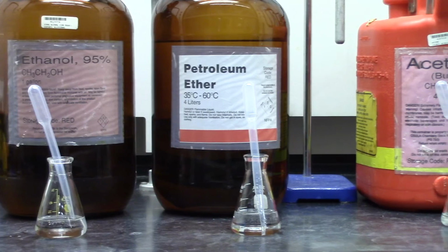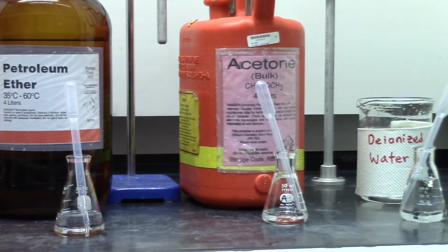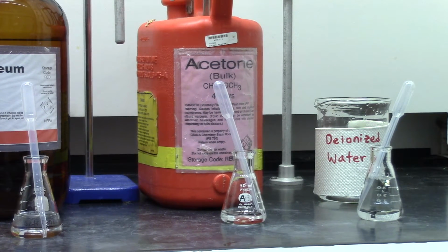There are two parts to this experiment: selection of the solvent for recrystallization and the actual recrystallization. Our experimenters, Teresa and Bibia, will guide you through all the steps. In the first part, we'll be testing water, ethanol, acetone, and petroleum ether and determine which one is suitable for recrystallization. An ideal solvent shall not dissolve the solid at room temperature, but will do so at elevated temperature, most commonly the boiling point of the solvent.